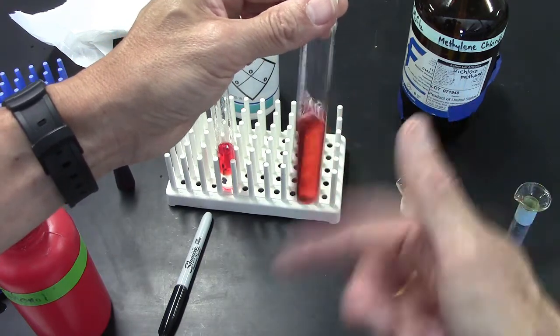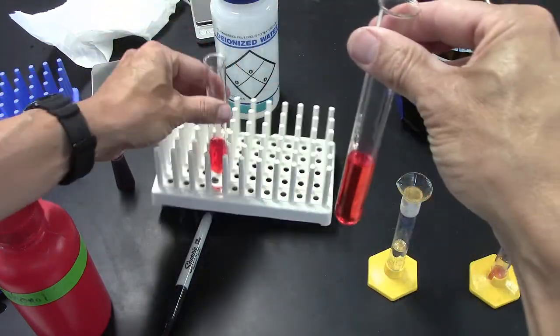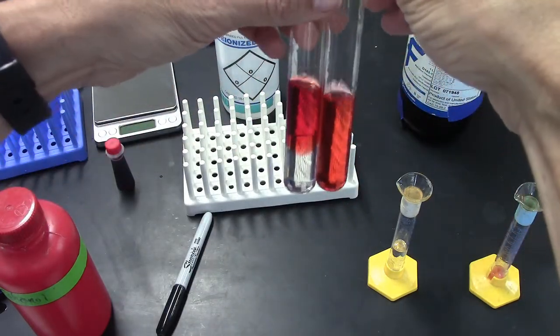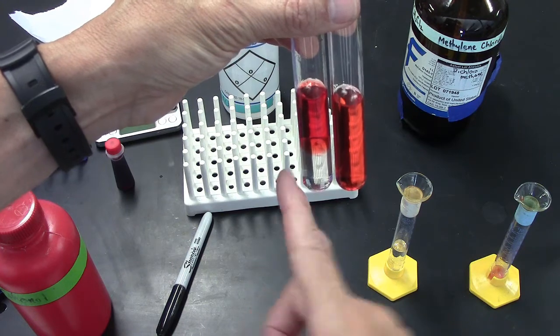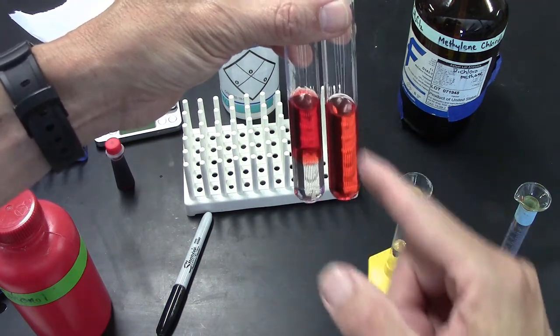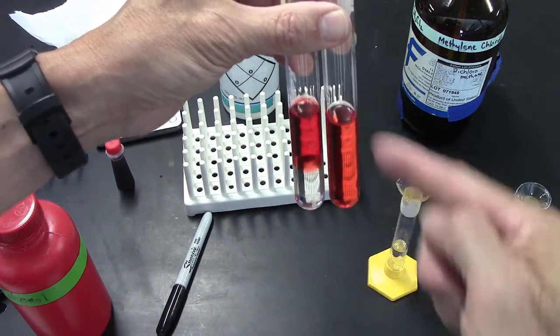They're all just mingled together. So sometimes you can keep two distinct layers like this, and sometimes they'll mingle together. Even though the liquids have different densities, sometimes they'll mingle together.